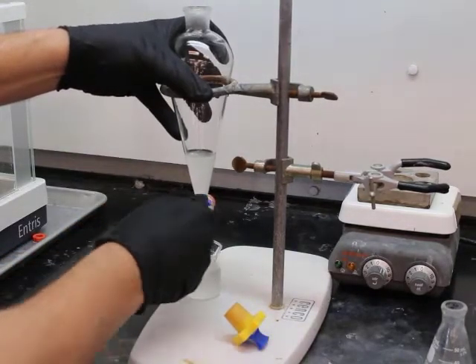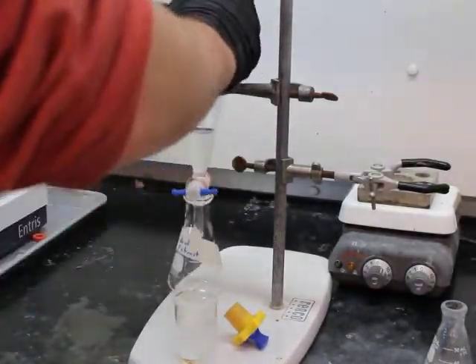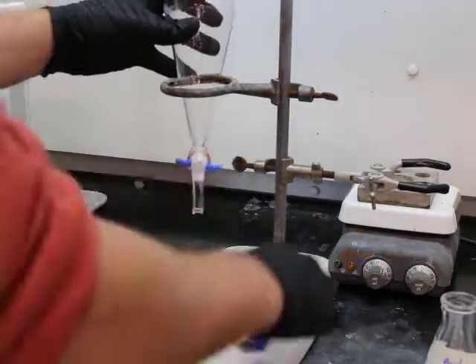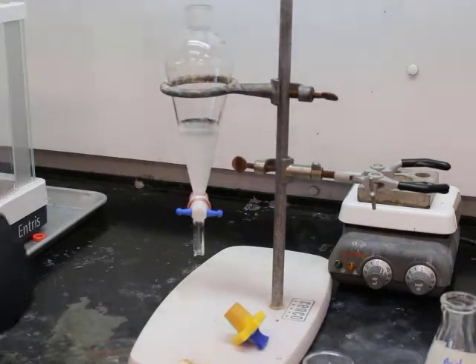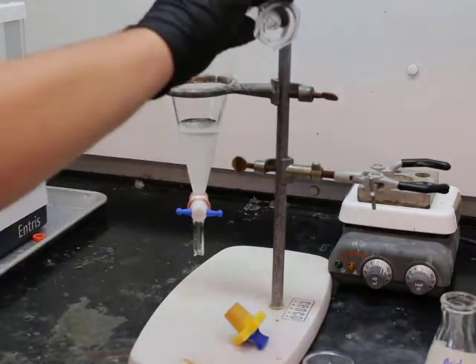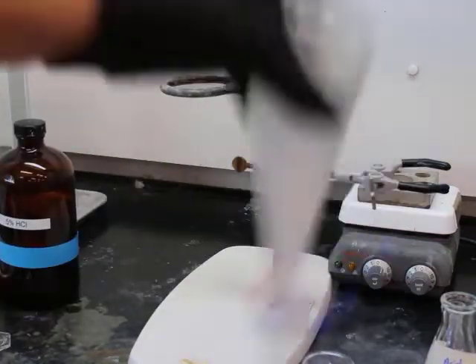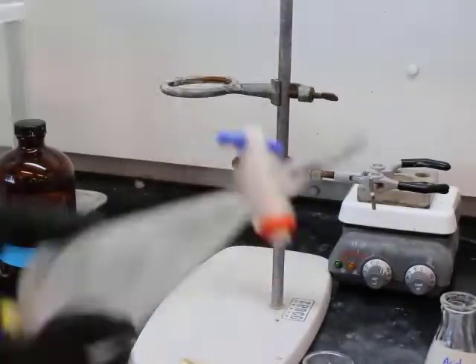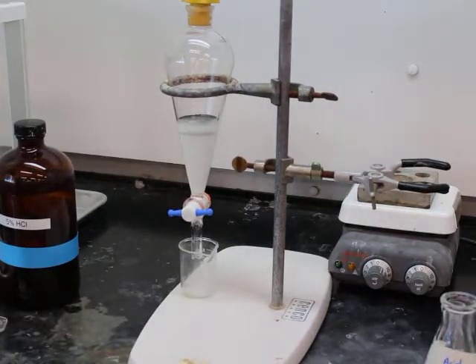Oh, and one note here, you'll notice that if you ever forget to take the cap off the top of the separatory funnel, you will notice that it starts to bubble, right? Because in essence, you have a vacuum and it doesn't want to allow the solution to drip out of the bottom of the stopcock when you turn the stopcock. So I'm doing this extract 3 times. Here's our second addition of HCl. The third addition I do not believe is going to be shown.